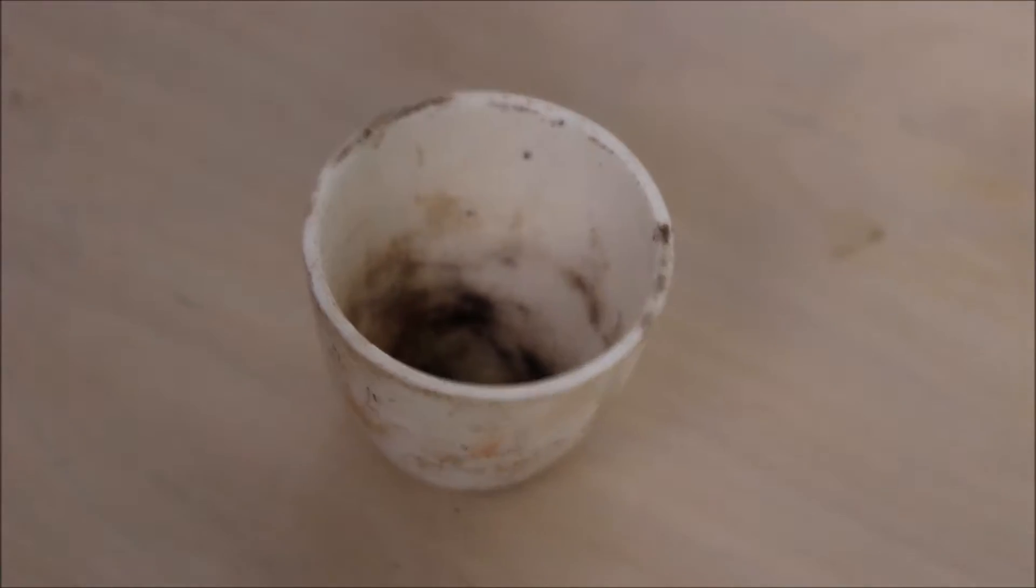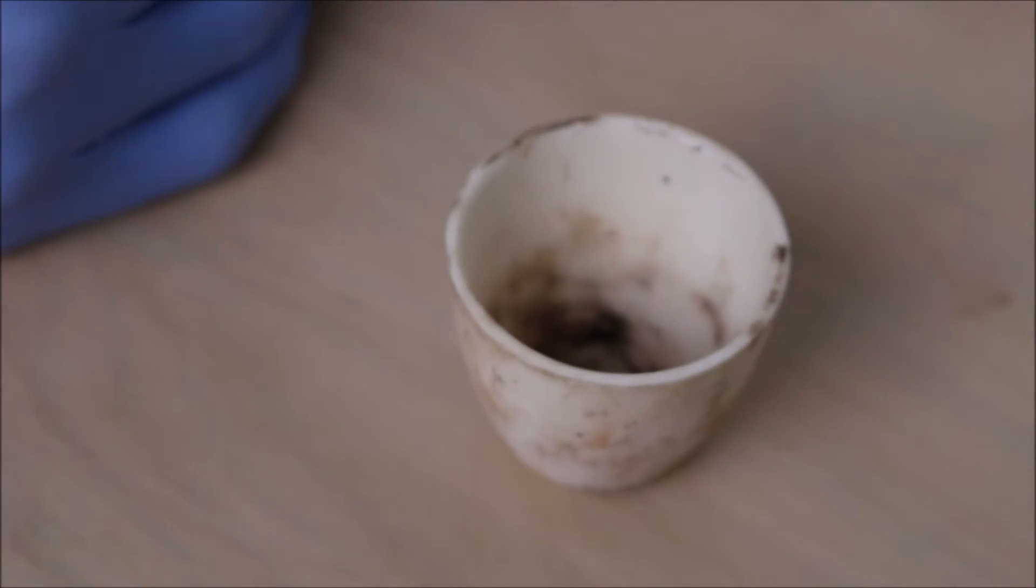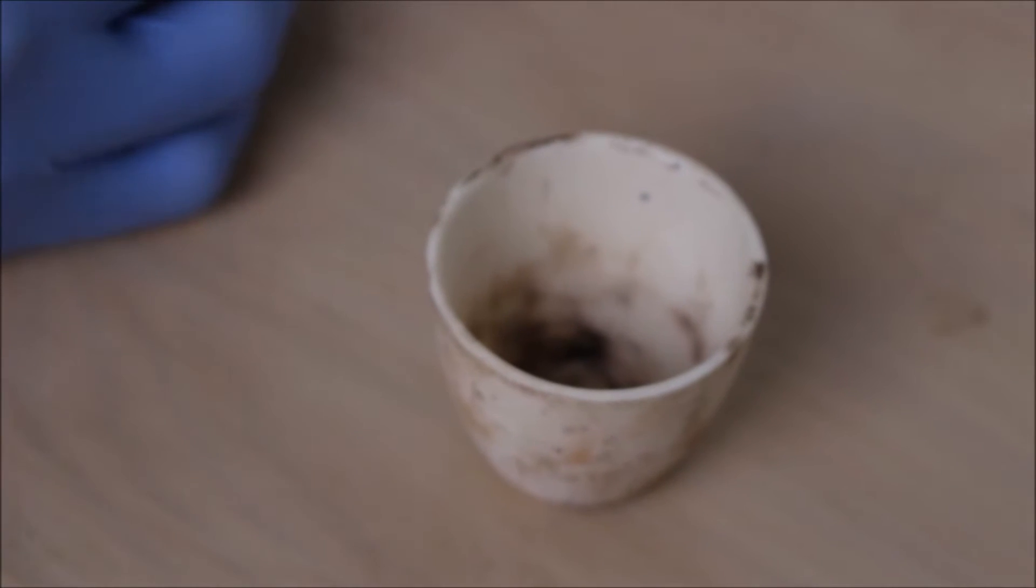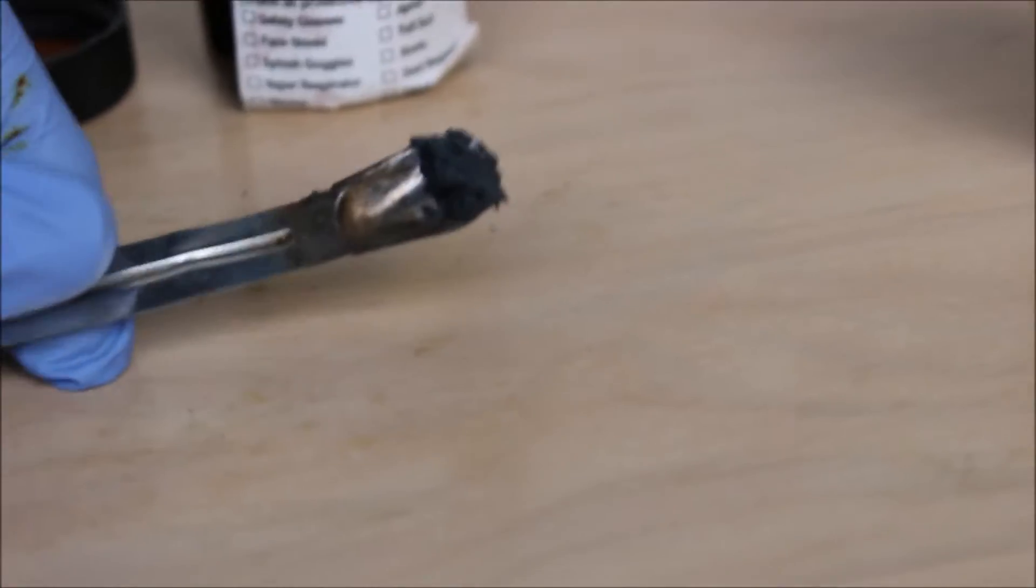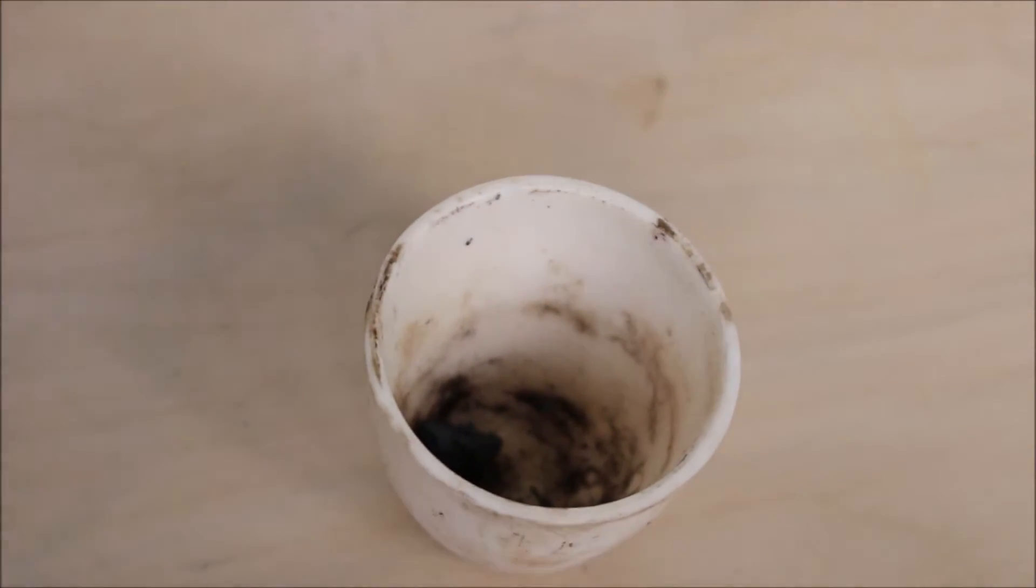So let's add some iodine to this crucible. Now that John is holding the camera, I'm just going to load some iodine into the crucible. What do you think about it, John? Here's the iodine, alright, we'll add a little more.